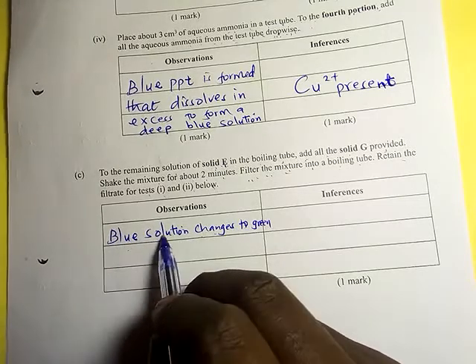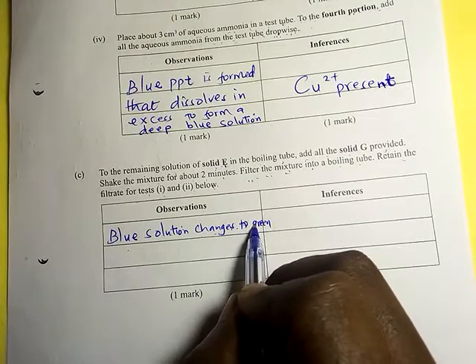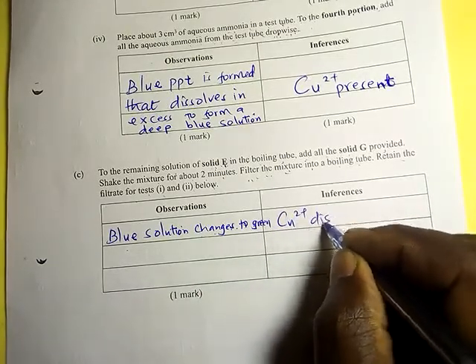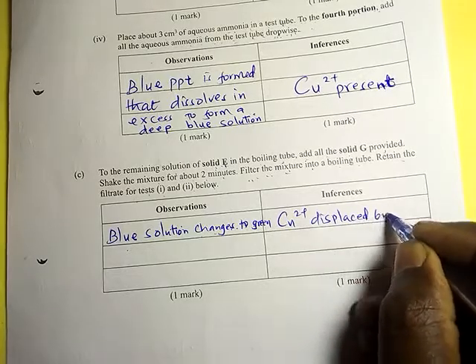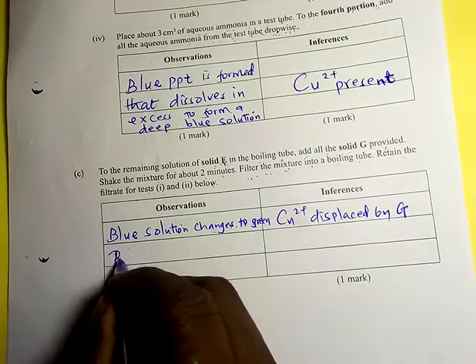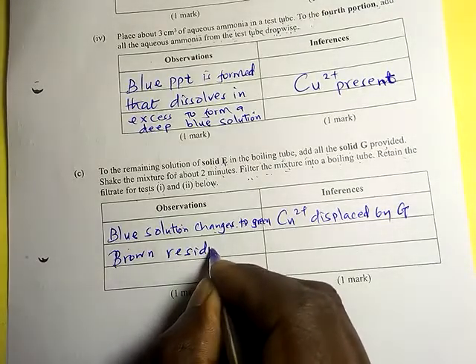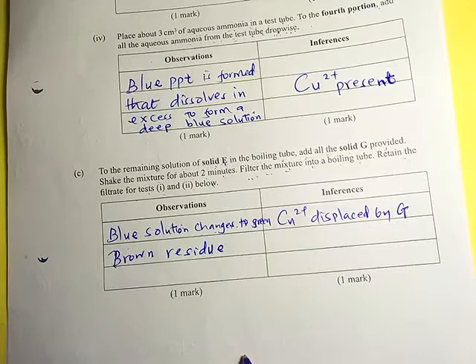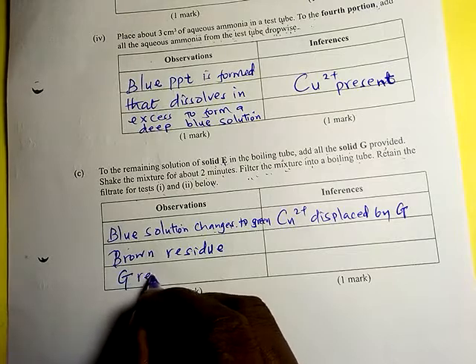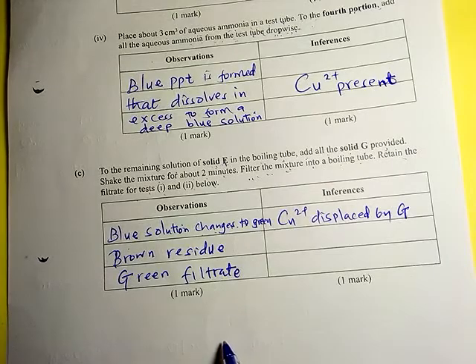The copper two ions have been displaced by G. What is green is iron two ions — therefore copper two ions have been displaced by G. A brown residue is also formed and remains. After filtration, we have a green filtrate. You can also note that Cu²⁺ was reduced by G.